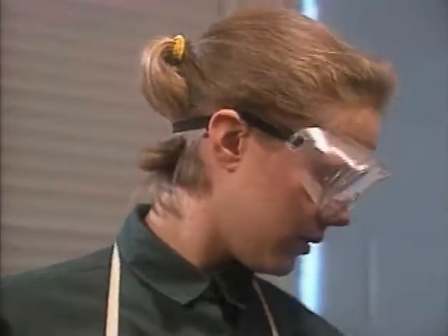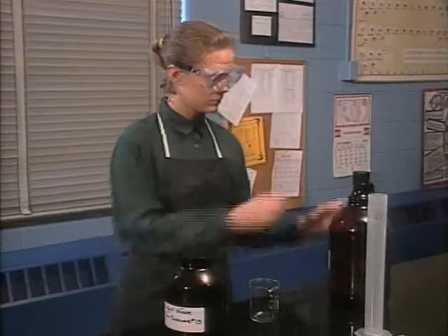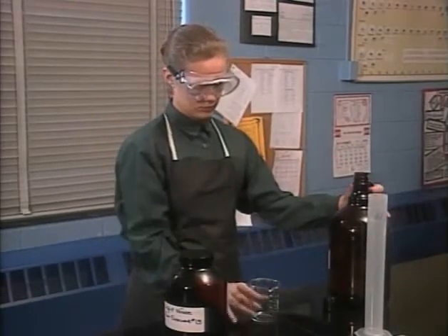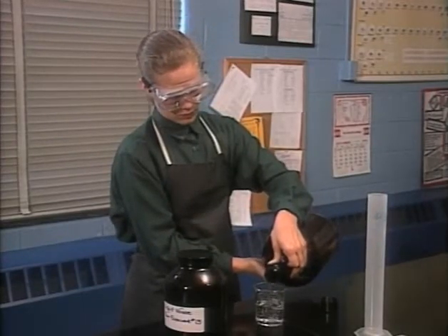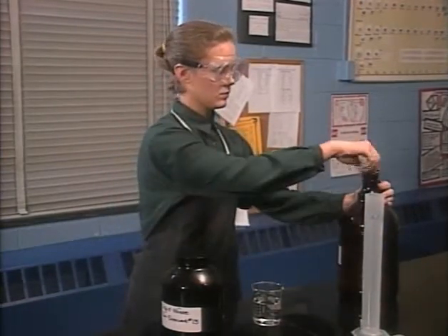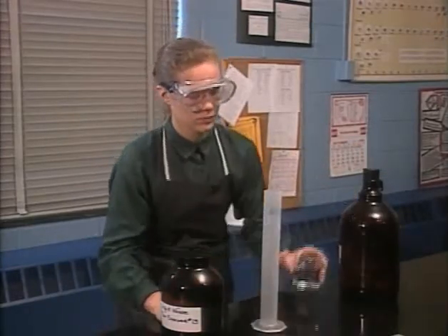Chemicals should be kept pure and uncontaminated. One way to prevent contamination is to use only clean glassware. Another way is to only pour out of a reagent bottle — never pour anything back in, even excess chemicals you haven't used. It's better to waste the excess than to risk contaminating the entire bottle with particles from around the lab.